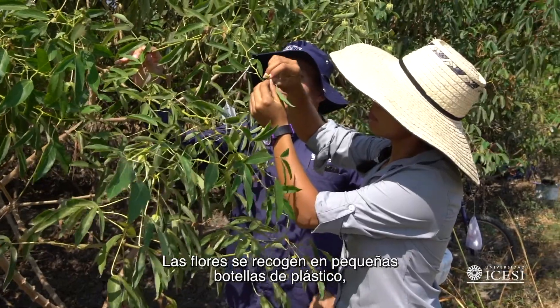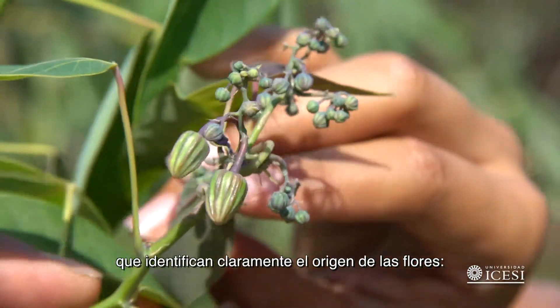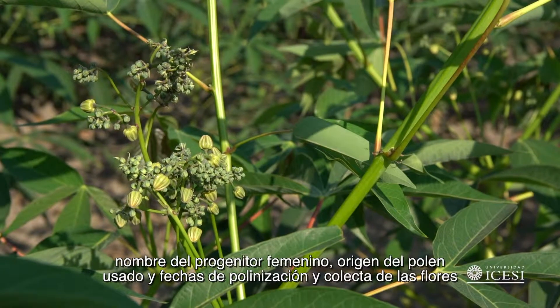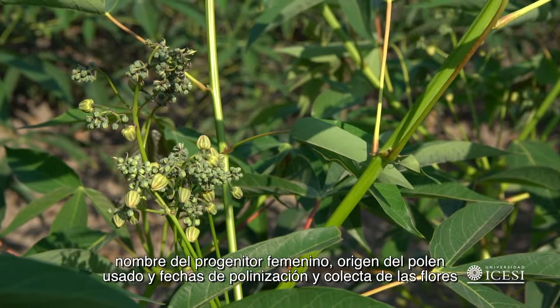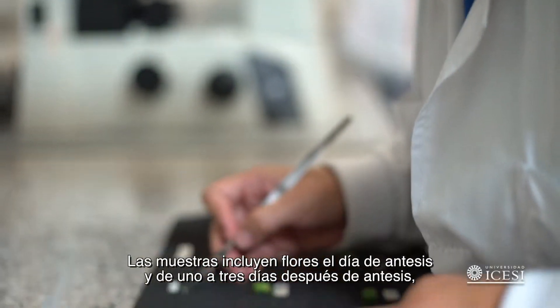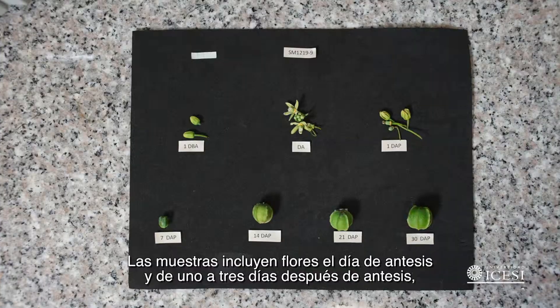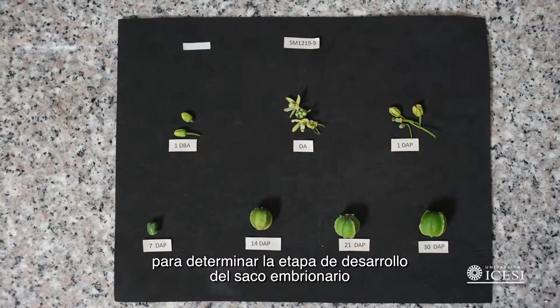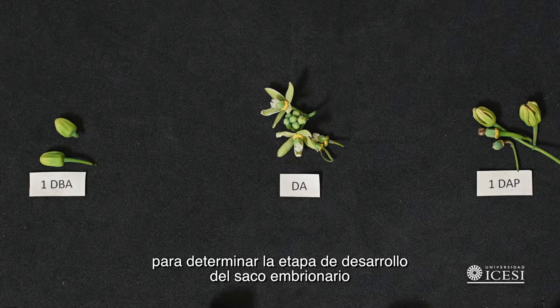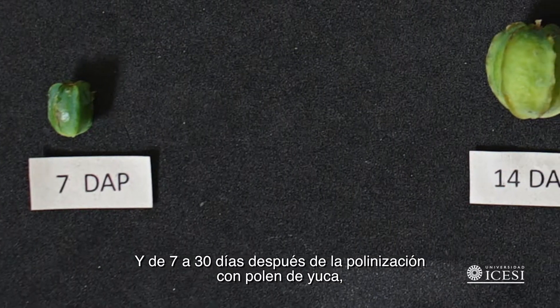Flowers are collected in small plastic bottles, which properly identify the origin of the flowers — the name of the clone from which they were collected. The samples include flowers at anthesis and from one to three days after anthesis, in order to determine the stage of development of the embryo sac, and from seven to thirty days after pollination with cassava pollen.